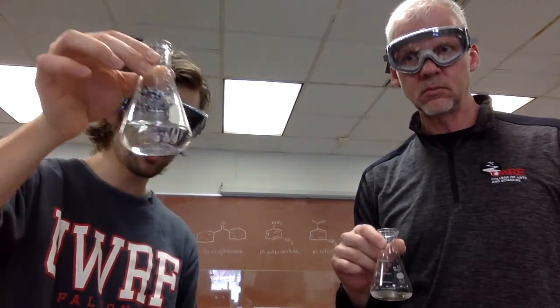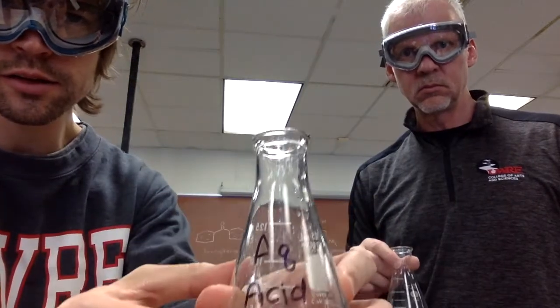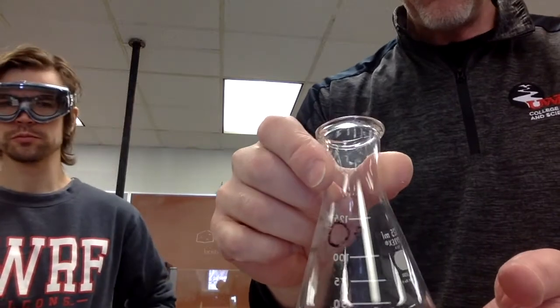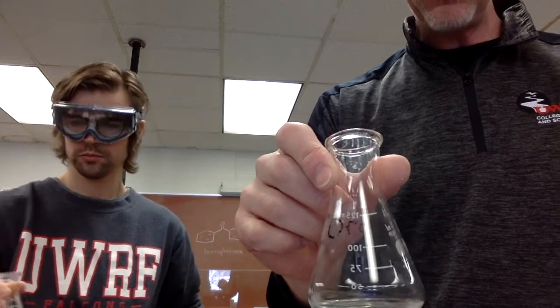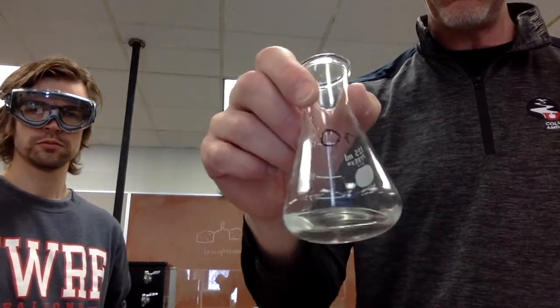So now we've completed the acid wash steps. So we have our aqueous acid. So it says right there. Oh, it's kind of hard to see. And then this is the leftover organic layer that we drained out of the separatory funnel. In general, with working a sep funnel, the bottom layers go out the bottom through the stopcock. The top layer would go out through the top, pouring it off. So we poured the organic layer that was left in the sep funnel into this one. So now we have our 3 flasks. We've got the aqueous base, which was the first extraction that we did. We've got the aqueous acid, which is the second extraction that we did, and then we've got the leftover organic layer here.